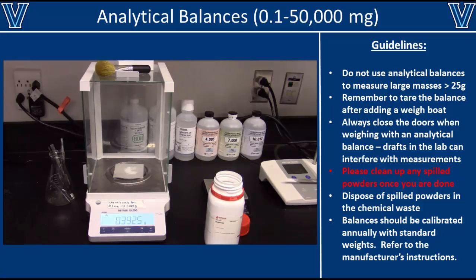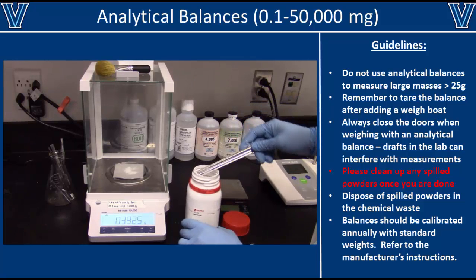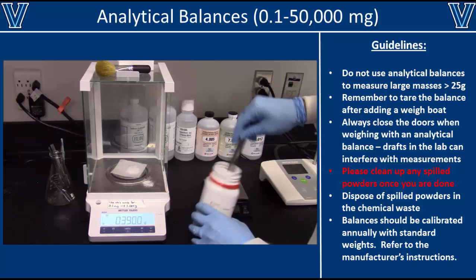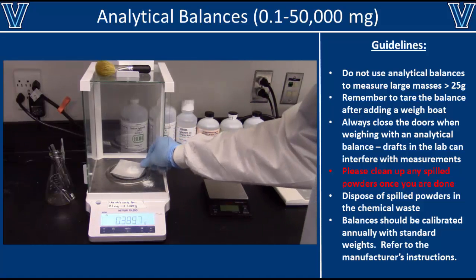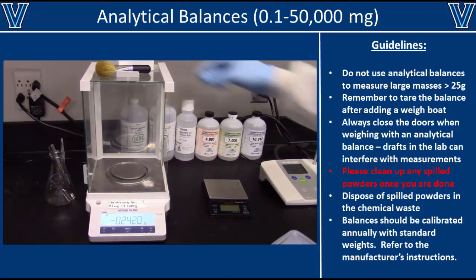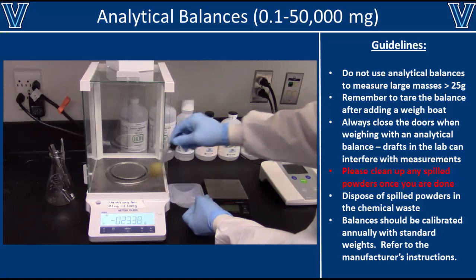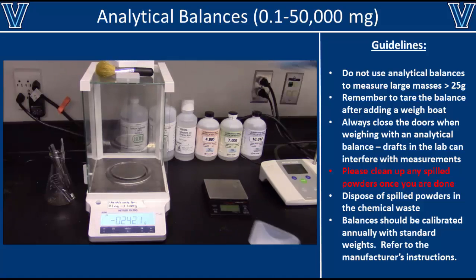As long as your spatula is clean, you may return any excess chemical to the original bottle it came from. If you are ever weighing out a chemical and you accidentally spill some of it on the balance or bench, you'll need to clean it up immediately. Begin by removing your weighed out chemical from the balance, then use a brush to clean up any spilled powder or crystals. Once you have it all cleaned up, make sure you properly dispose of the chemical.